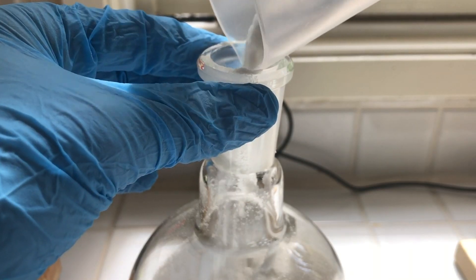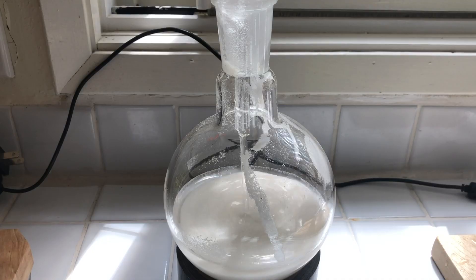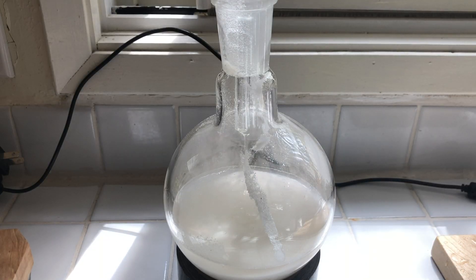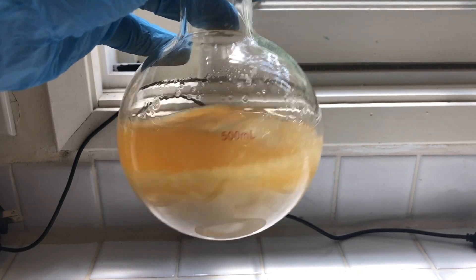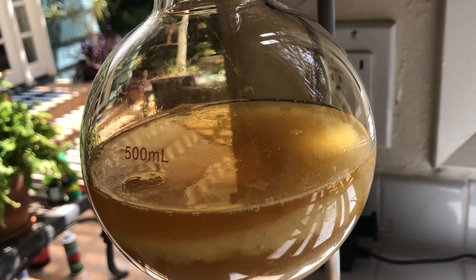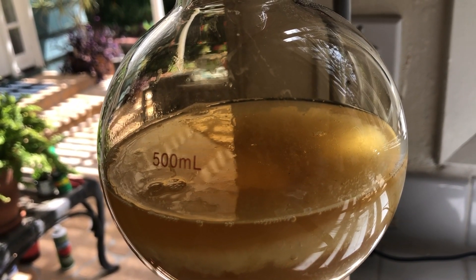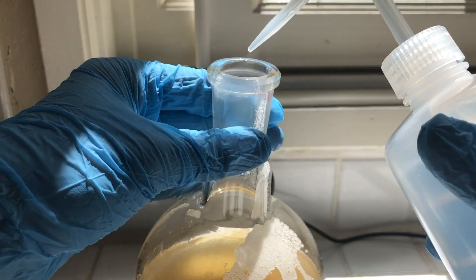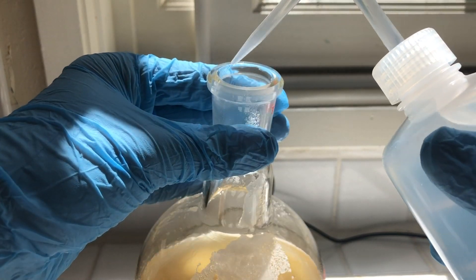The water and the potassium nitrate were added to a 500 milliliter round bottom flask, and then the sulfuric acid was added slowly. The contents of the flask then turned orange-yellow. This is probably nitrogen dioxide gas already forming from the heat produced by dissolving the sulfuric acid in the water. I washed the neck of the flask with some water to get rid of potassium nitrate that was stuck on the joints.